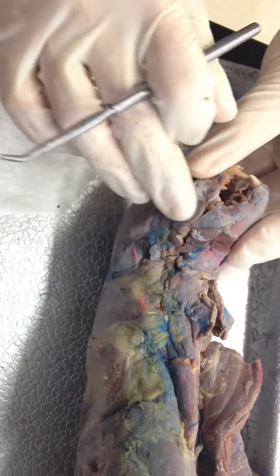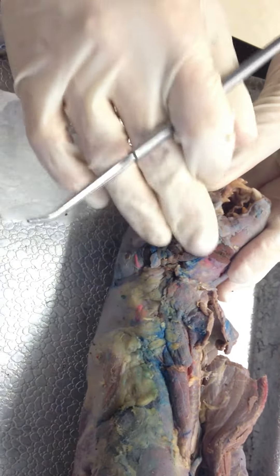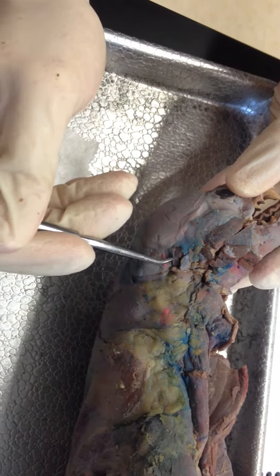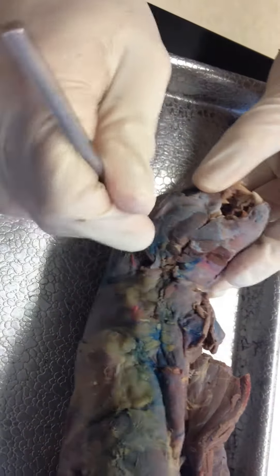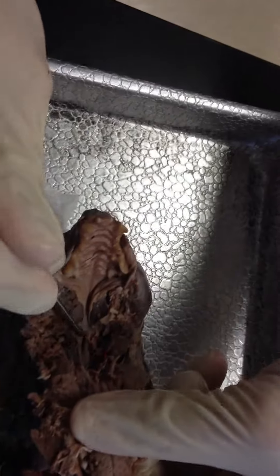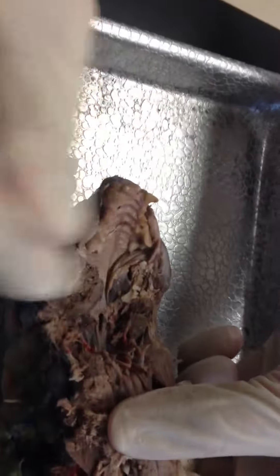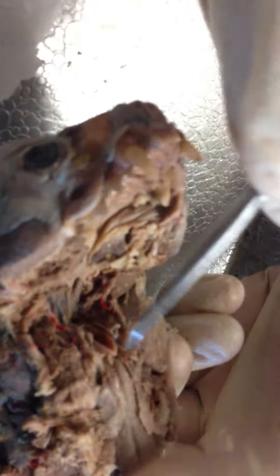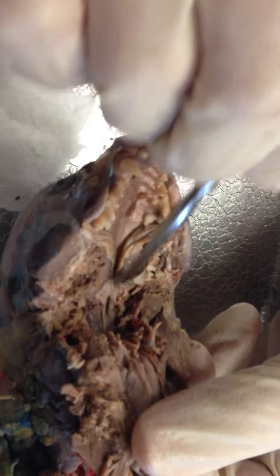You have your mandibular salivary glands, your parotid salivary glands are behind your auditory meatus, which is that hole. You have your opening to your nasopharynx right here. Back here you have an opening to your glottis, which goes to your trachea, and this is your epiglottis, this little flap. You have your tongue, your hard palate, your soft palate.